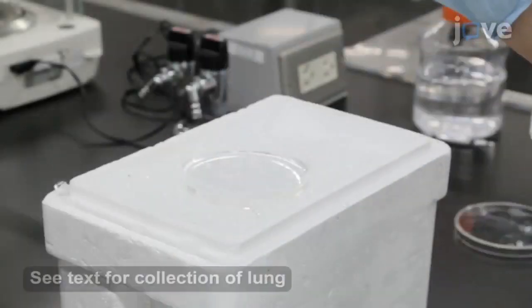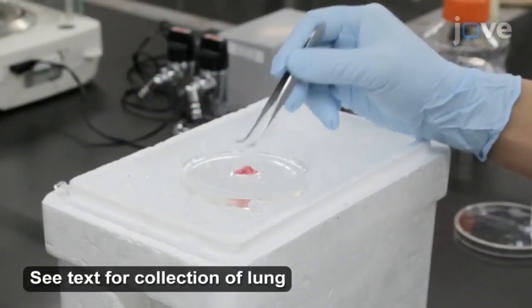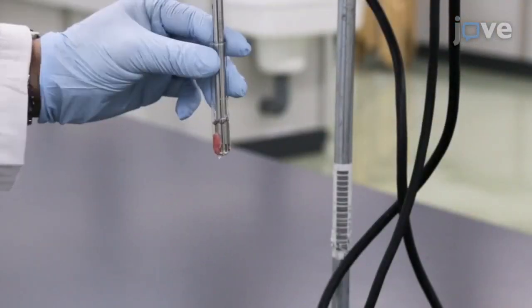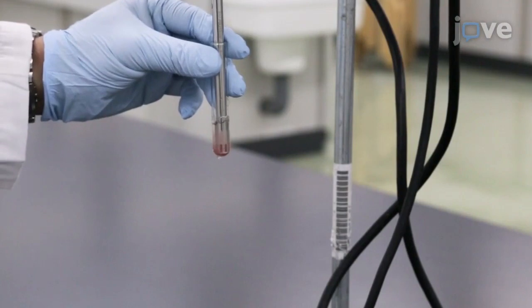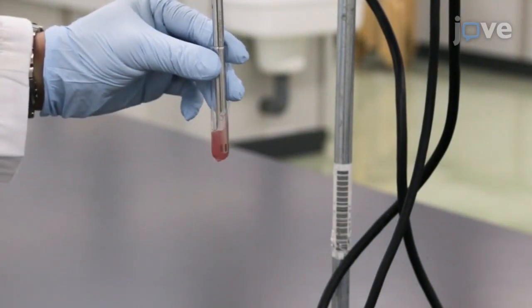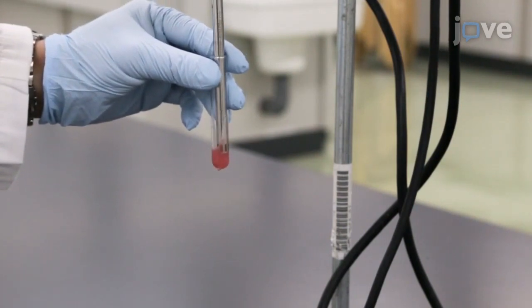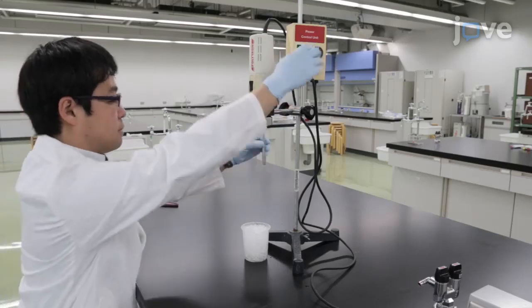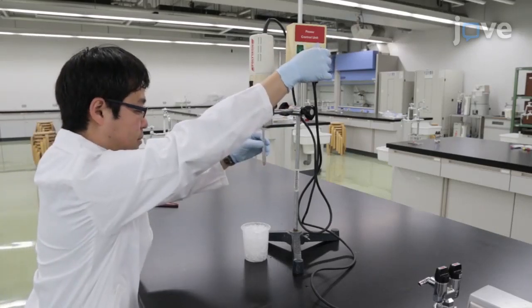Cool lung tissue samples obtained from male ICR mice on ice. Homogenize the samples at 20,000 RPM for 30 seconds in a blender. Repeat this step until the samples are completely homogeneous. Do not homogenize for more than one minute continuously in order to avoid an increase in temperature.